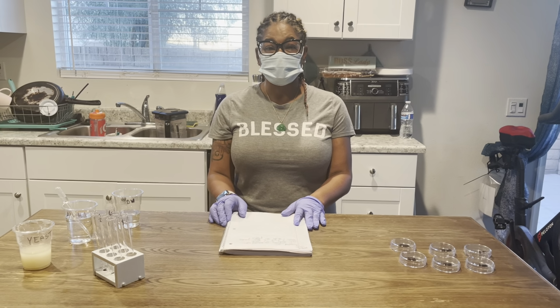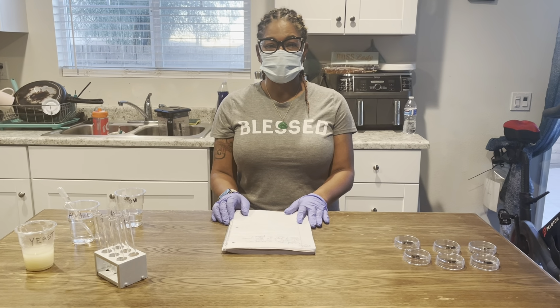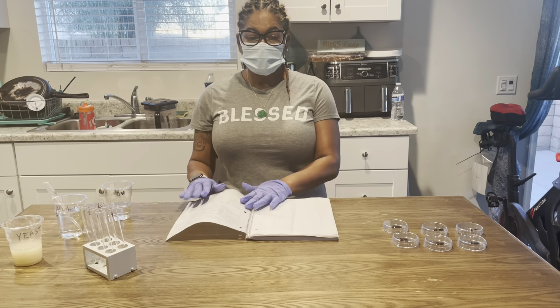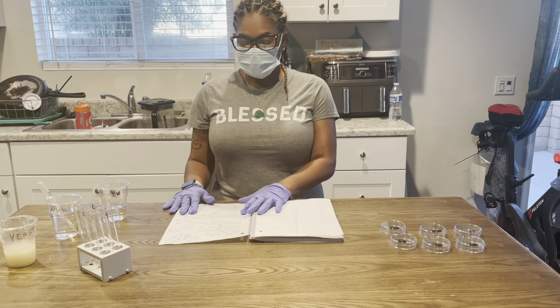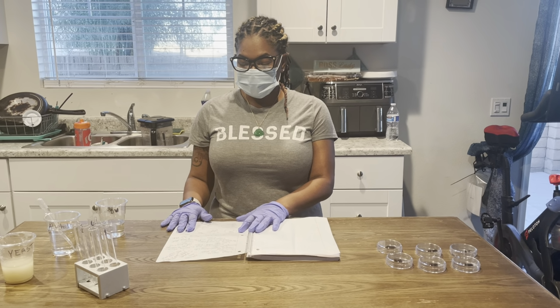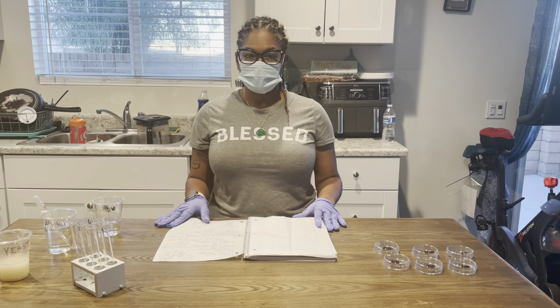I'm in the class Microbiology, Bio 225, and I will be discussing my lab today for week 2 of the bacterial enumeration of dilutions and plate counts experiment.